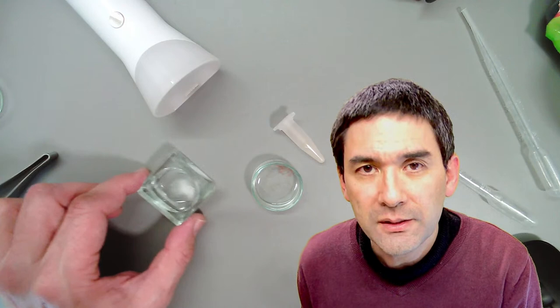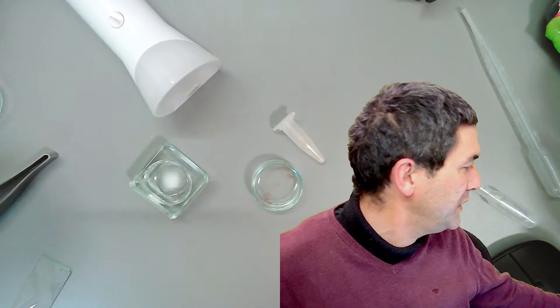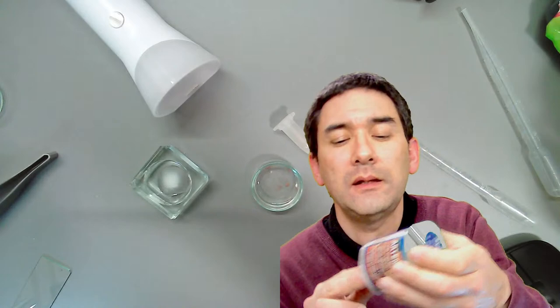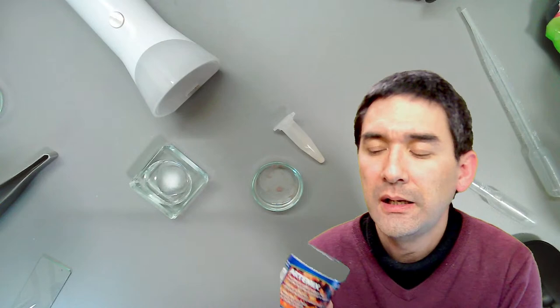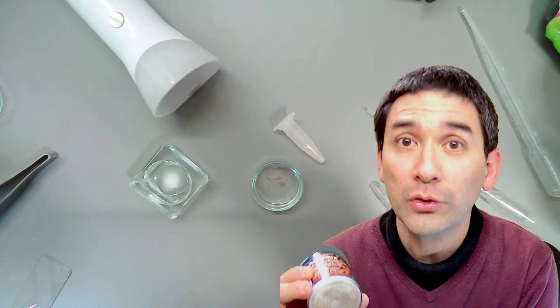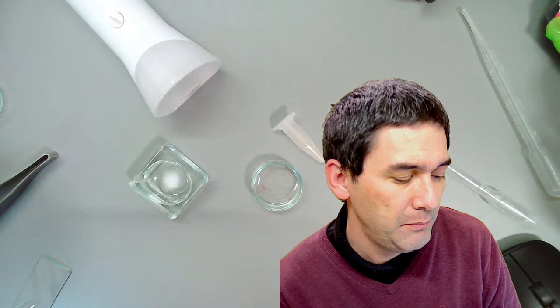On the salt concentration for Artemia: the kit I have says 16 grams of the mixture goes to 500 milliliters of water. It's a ready-made mixture, so you can also Google the exact percentage if you're preparing your own. You dump everything into a predefined volume of water and the proportion is correct.